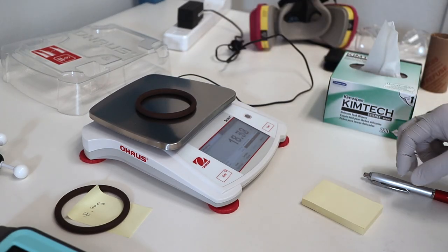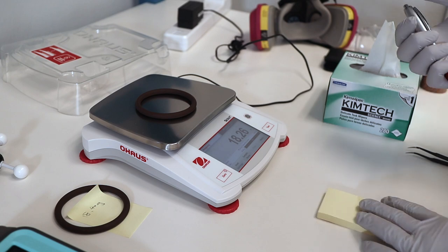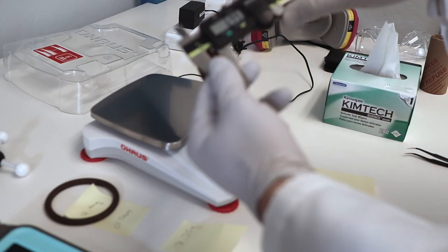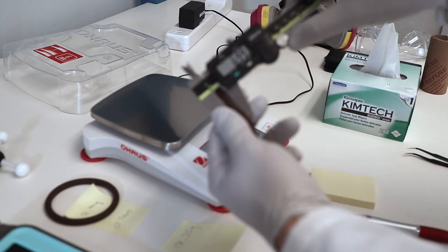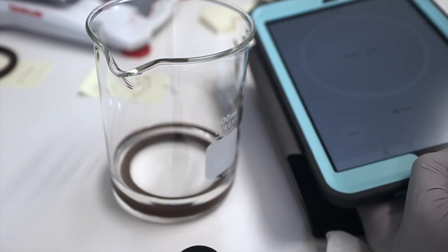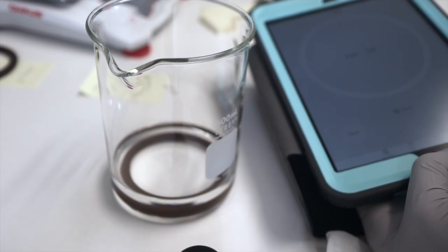First, we measure the original weight of the samples and the cross-section thickness. Then we pour some acetone into the beaker. Then dip the O-ring into the beaker. Start the timer and wait for 5 minutes.